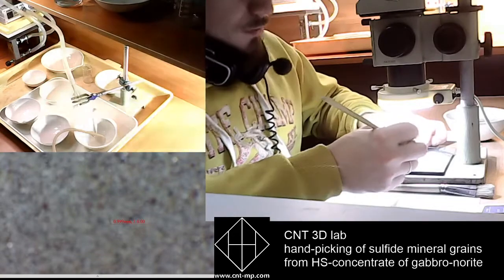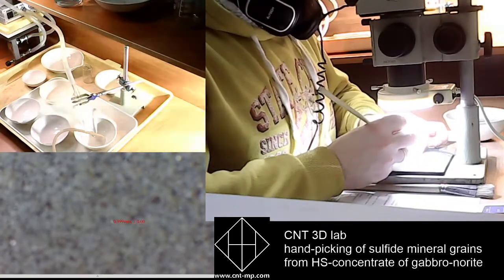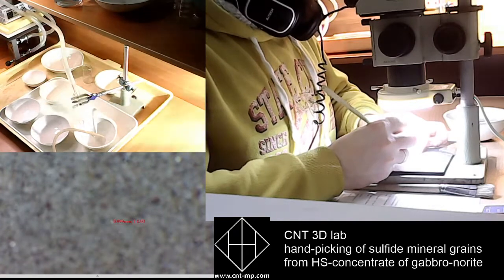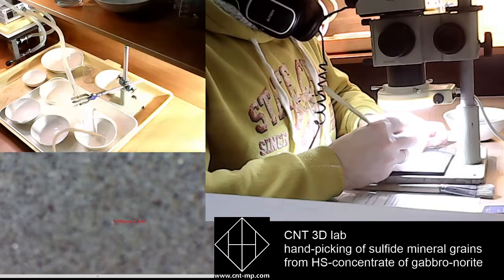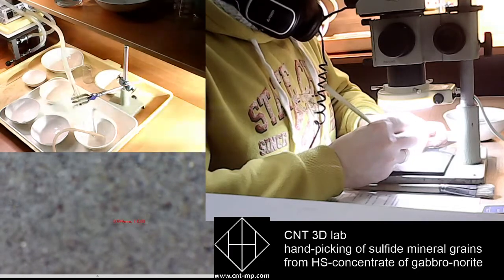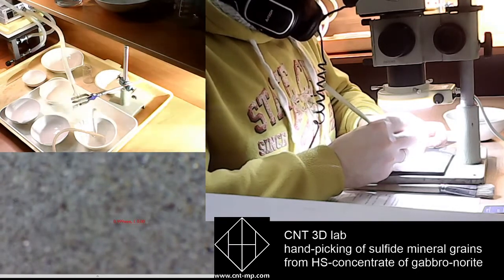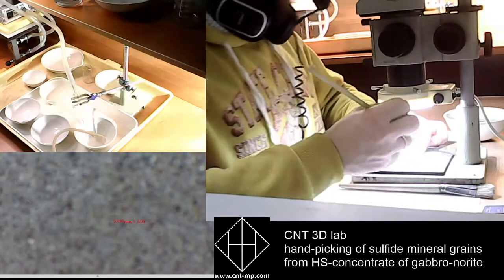So I've already collected about 30 grains. Let's take a look at how they look. But it's still not enough for isotope analysis.